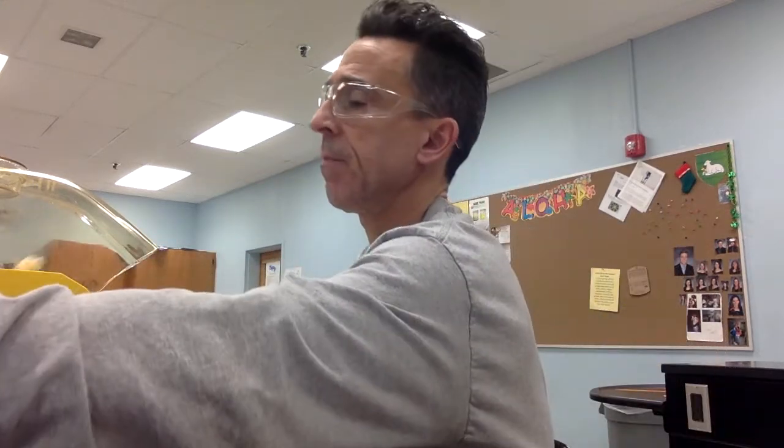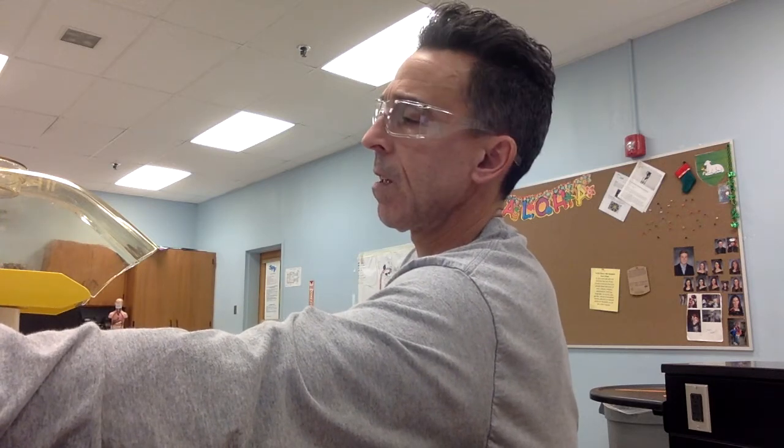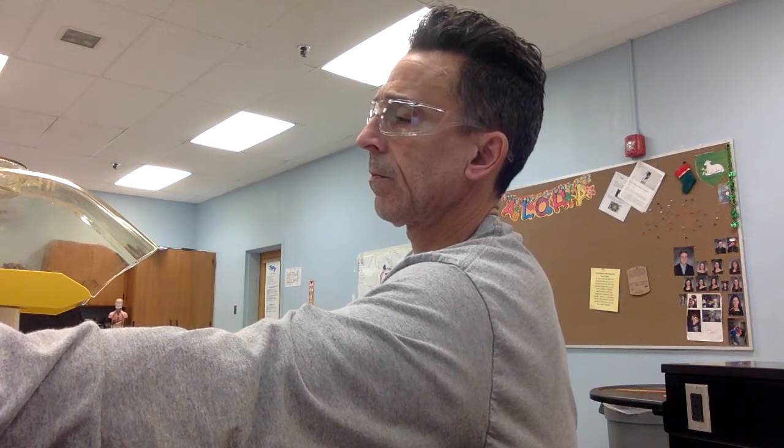All right, we're good. Right, I think we're good there. So we have our popcorn. And I'm going to just cheat a little, use my fingers, and you're going to say why I shouldn't later.